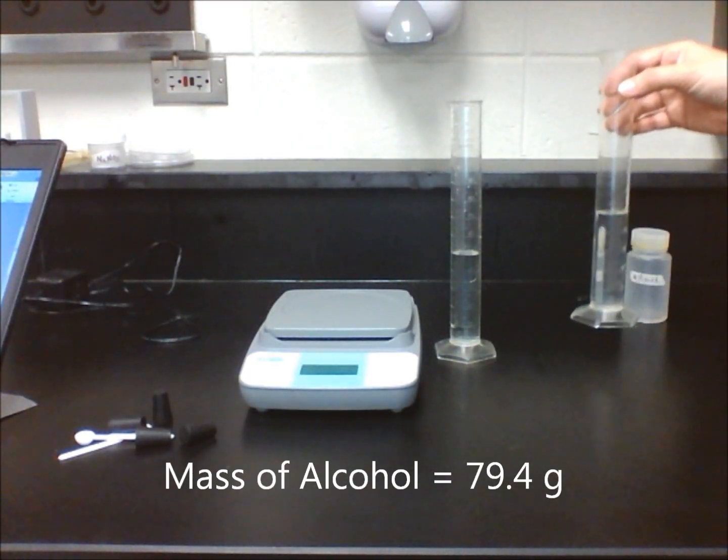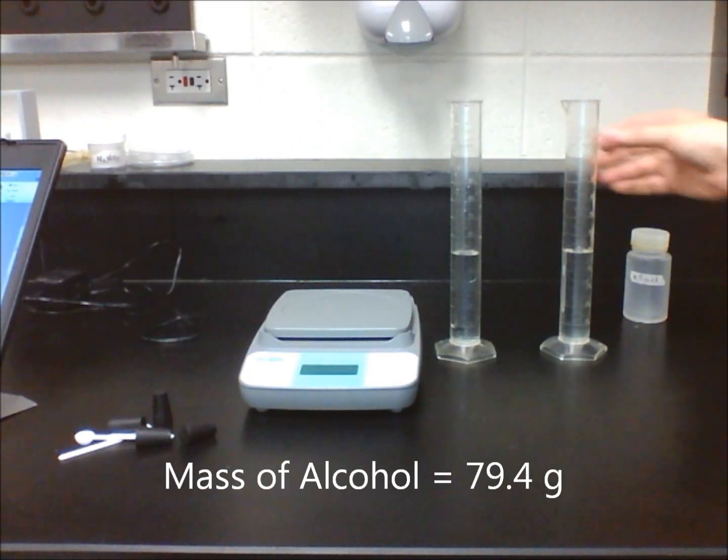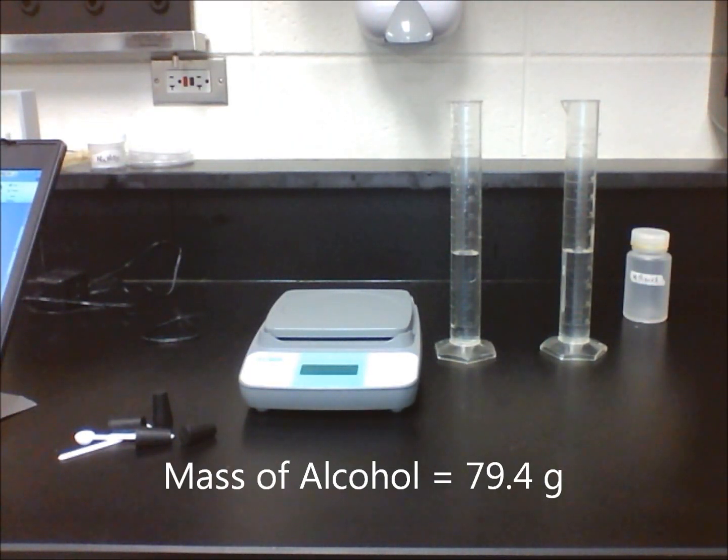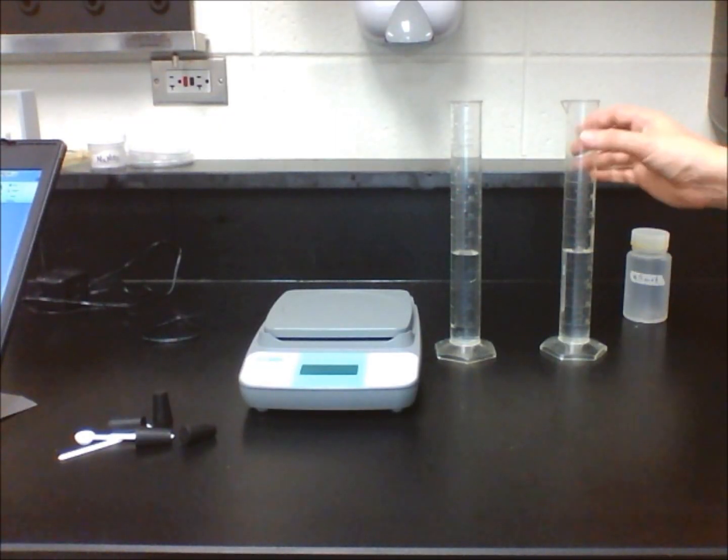Use the information you recorded to make a prediction of what you think the mass and volume will be when you combine the substances.